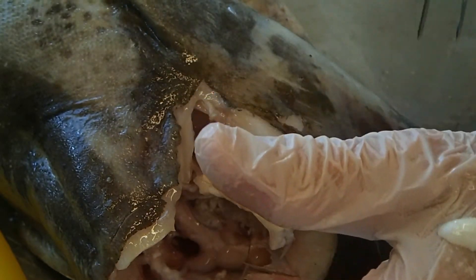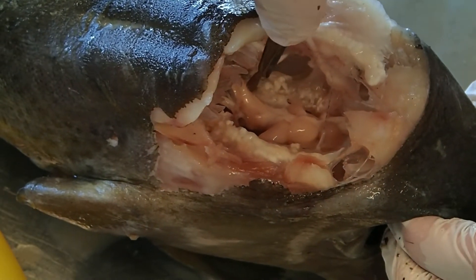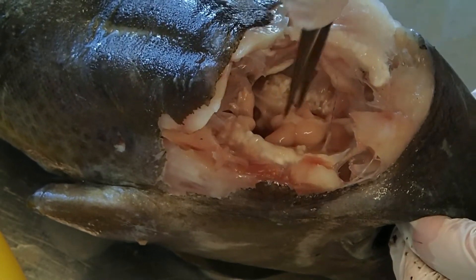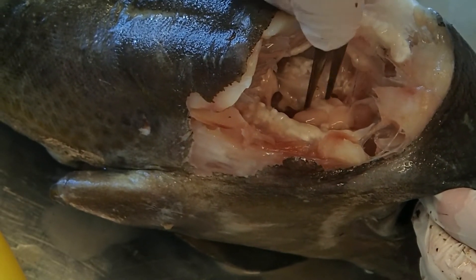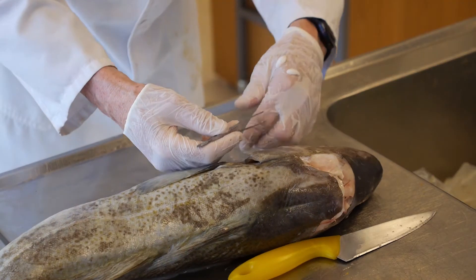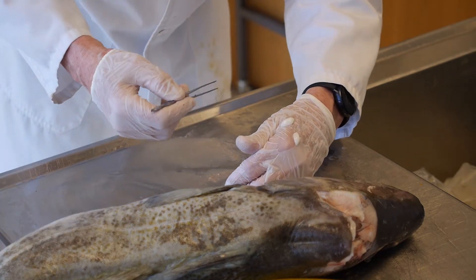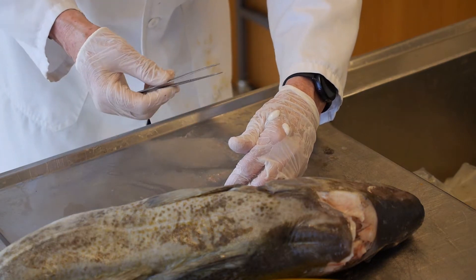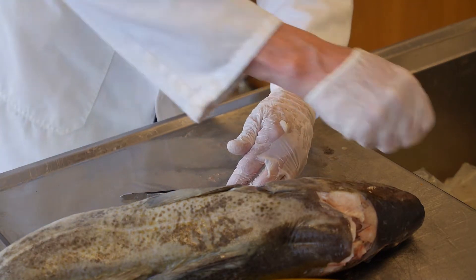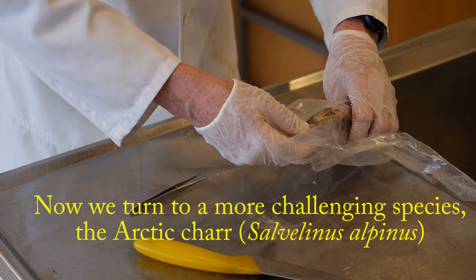You can always take your finger and just rub the tissue off. This one's very clean. Sometimes tissue will be on it but you don't have to worry about it. Now we're going to go to the other side — there are always two of them. Keep in mind this otolith is never attached to anything, it's always by itself. It is right there and there's the other otolith. So we have two otoliths right here and as I say these are large as otoliths go. They are very tough — you don't have to worry about breaking them unless you smash them with a hammer. Clean the tissue off and we usually put them into a paper envelope or a vial and you're ready to go. That's it for the cod.